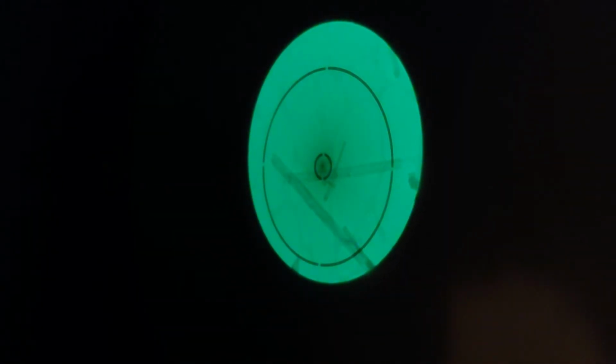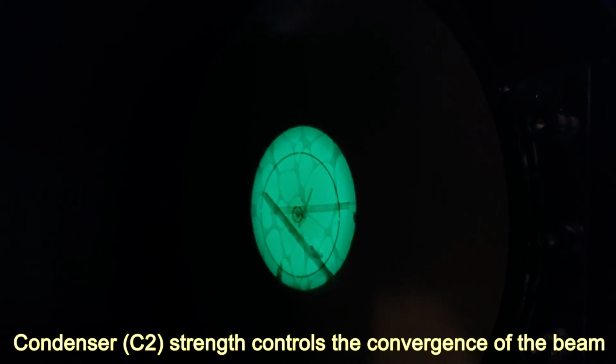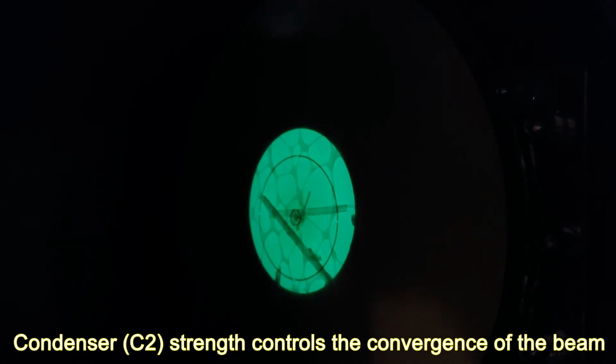Here you see it in focus. When I've set the eucentric focus, I've set the objective current to whatever is calibrated. This is calibrated to the rotation of the goniometer. So now I can underfocus a little bit. And if I change the condenser, I change the size of the illuminated region. So I'm changing the C2 lens. I change now the size of the illuminated region.